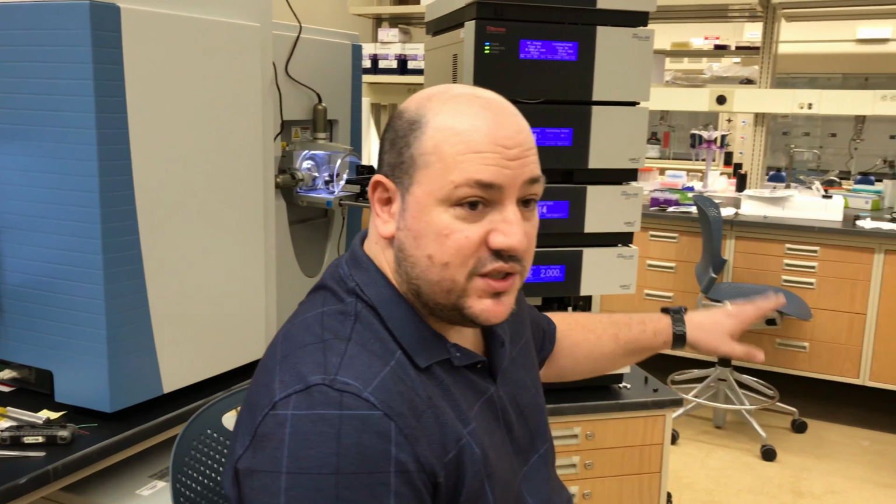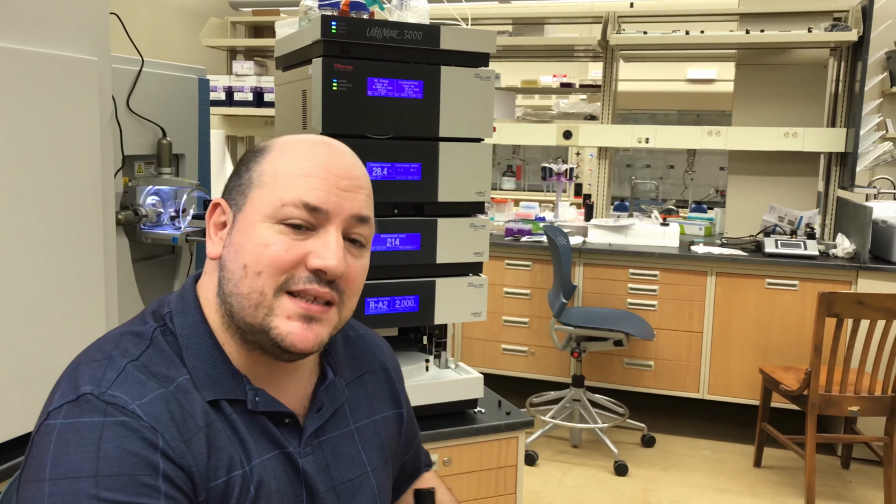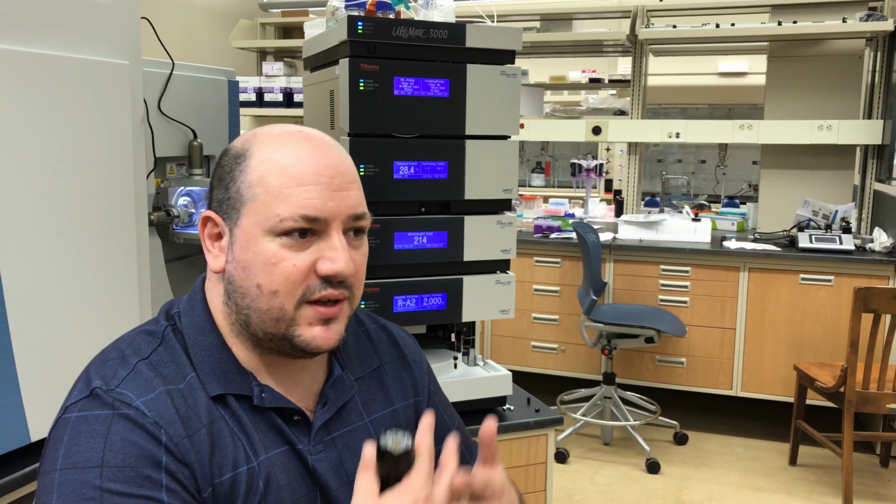In addition, on my left, which is not visible from here, you have an entire wet lab dedicated only to mass spec sample prep. You can come here and do the sample prep so that you don't have to worry about the right chemicals or the right procedure. I will actually help you develop those procedures, validate them, and execute them. So I hope you will join us soon, and that's it.